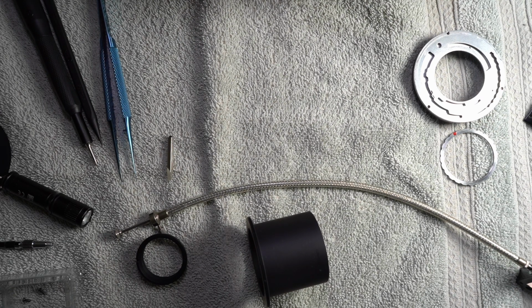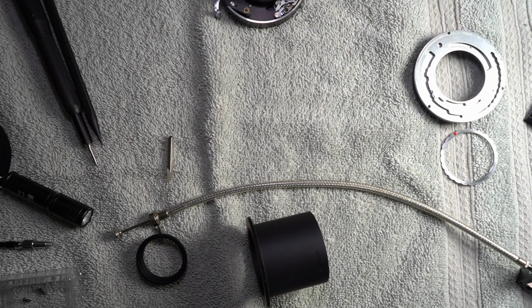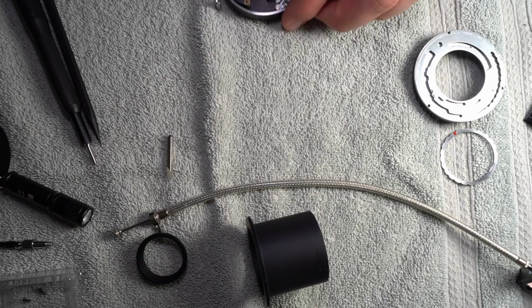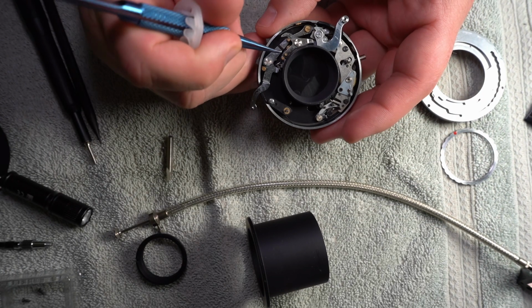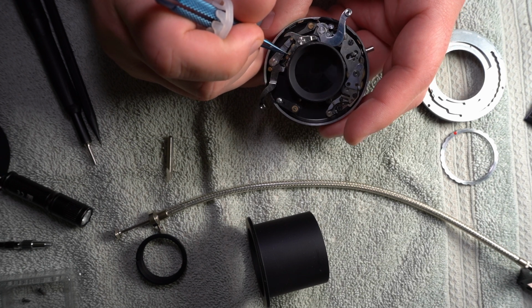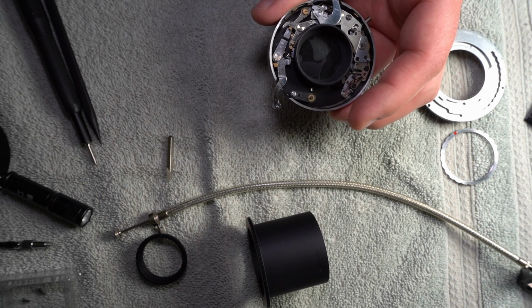I think that these are the only two pins that really matter at this point. And I'm going to go back to my tweezers because I think that they're better at this part. This isn't really going to be in focus for you, I'm sorry, but I'm also sorry about rubbing my face against my mic there.